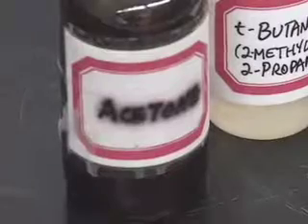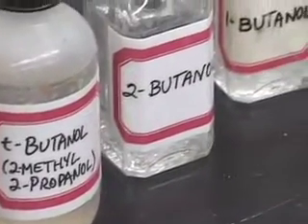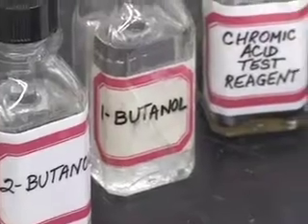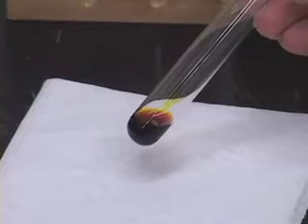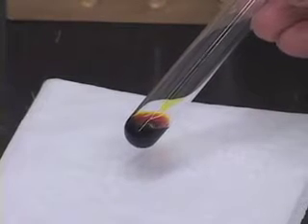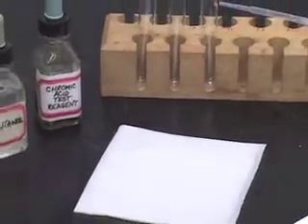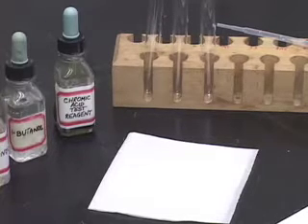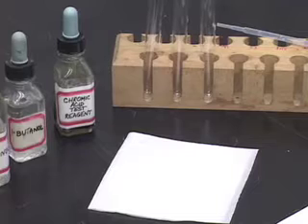The chromic acid test is done to test for the presence of primary and secondary alcohols. The test reagent, chromic acid, is a yellow-brown liquid. When you add it to a compound which has either a primary or secondary alcoholic functional group, it gets reduced to the green-blue chromic ion. If it does not get reduced to the green-blue chromic ion, then we know that the test compound is not a primary alcohol or a secondary alcohol.